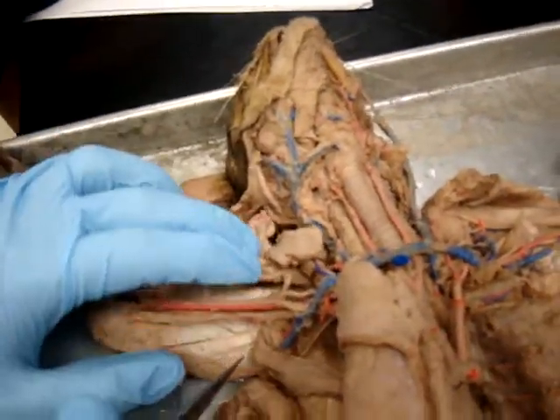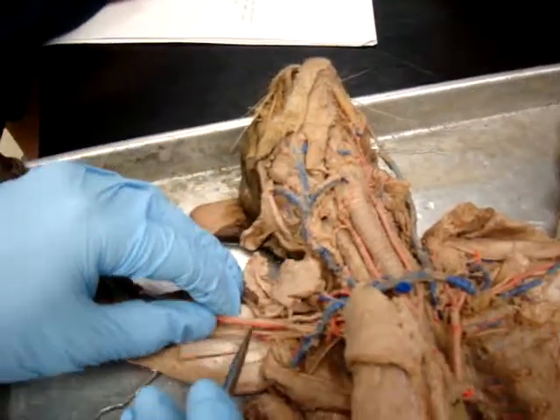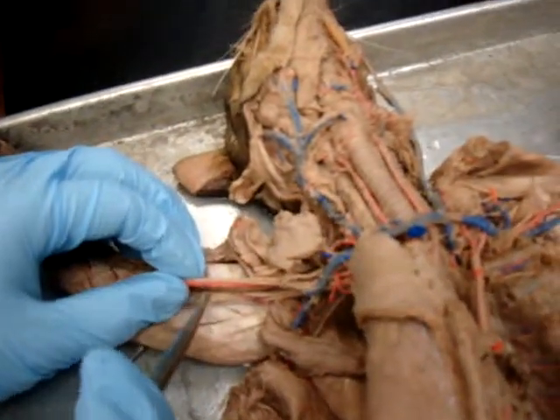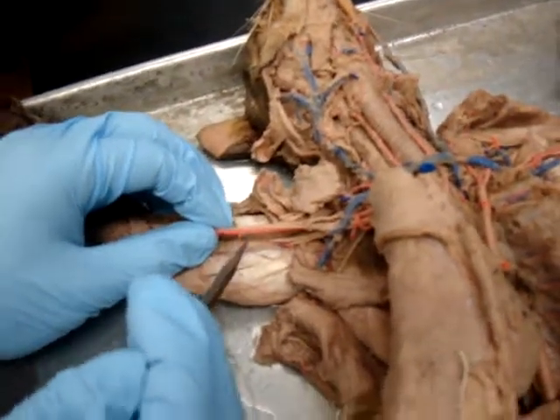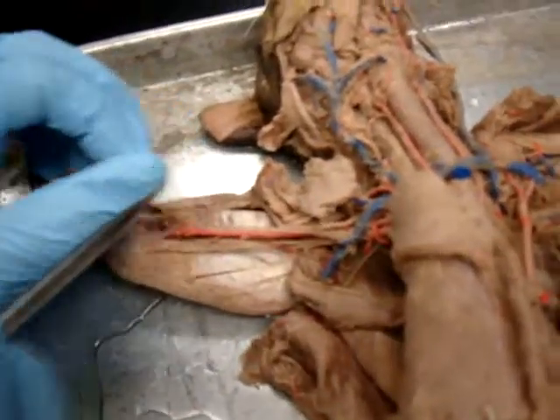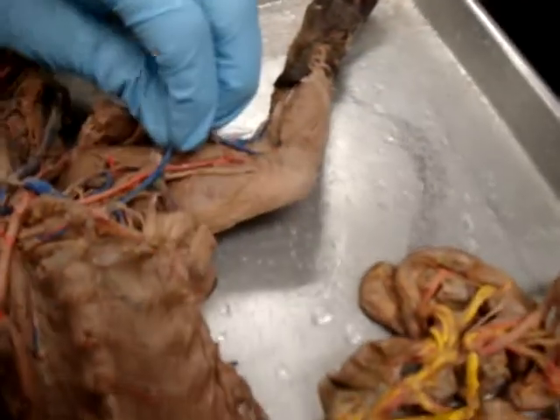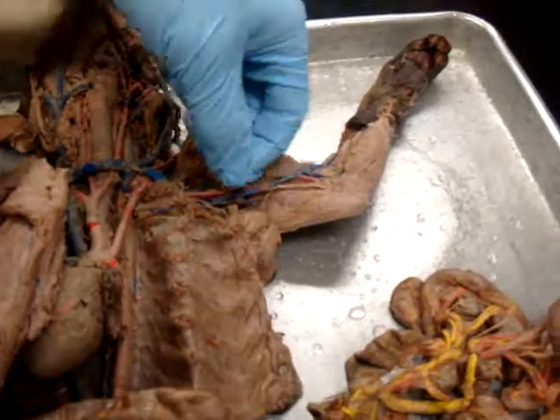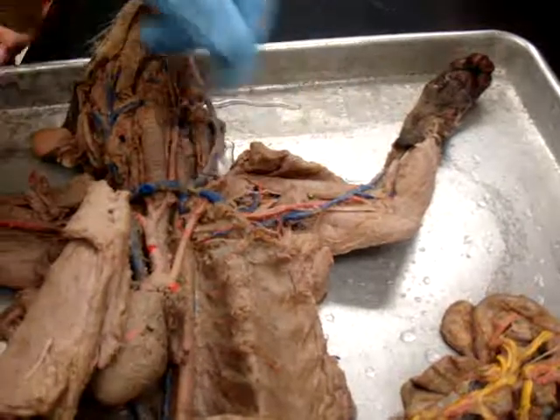And then there's a deep brachial. There is a deep brachial in the cat. It's going to branch really low down, and it's broken, but it's probably this one right here. It's hard to see usually. Well, not always hard to see, but it branches further down, like in the middle of the arm. Okay. Let's look for it on this side. Let's see if it's broken here. Yeah. Apparently, it would be too much to ask for a non-broken one. Yeah, that's one of mine.